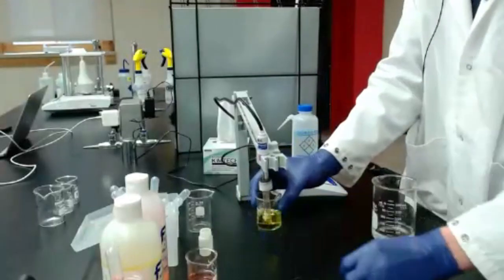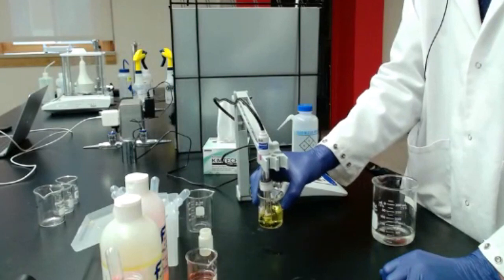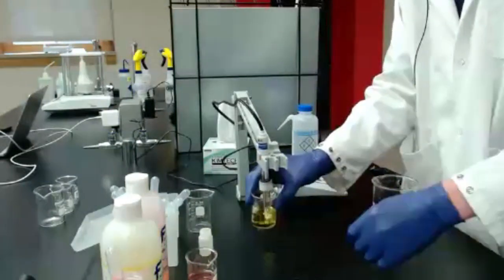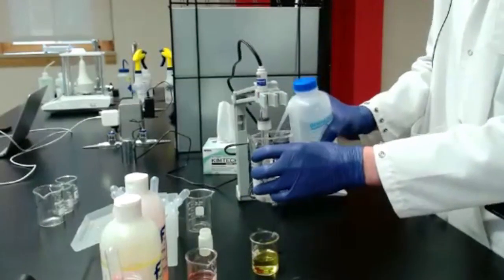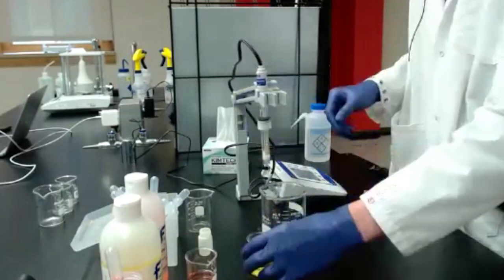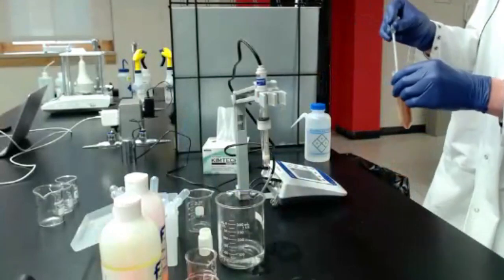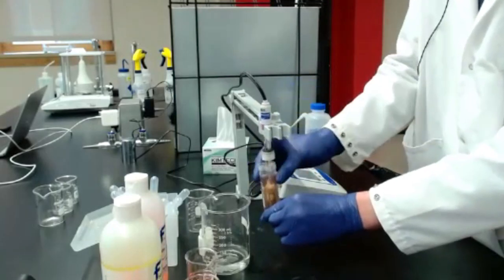I'm going to go ahead and re-standardize at pH 7. All right, let's see here. Okay, we've got good calibration now. I'll rinse that off again, and then we can move on to our sample. Okay, so same thing. Now I have my pH probe in my juice sample.